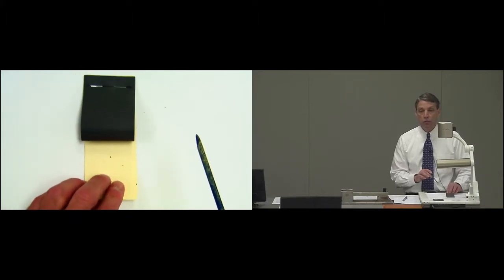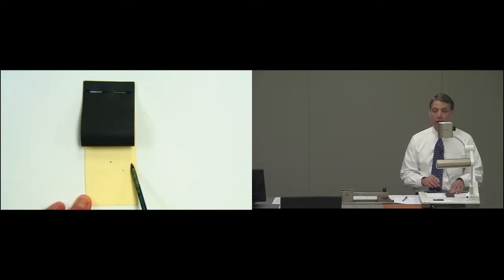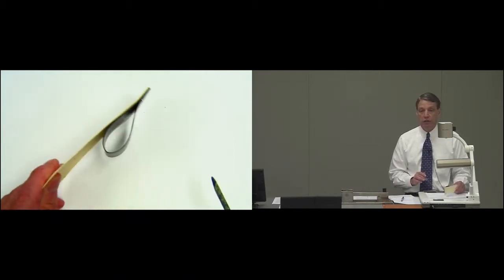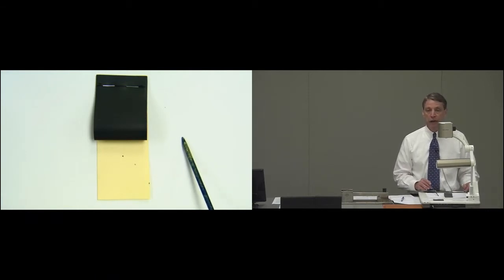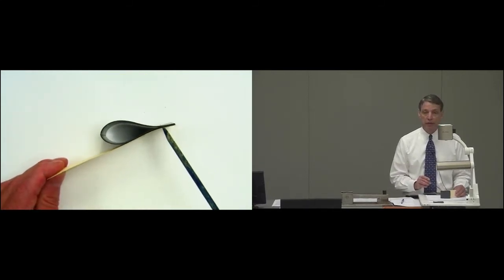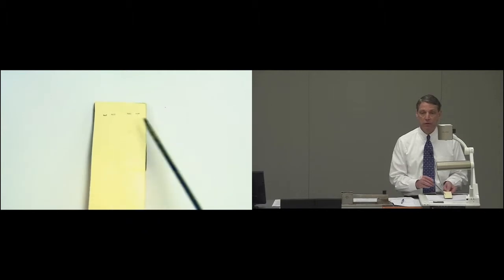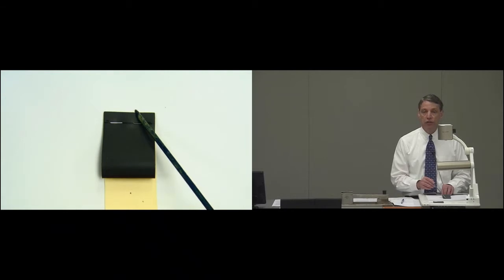The folded loop is attached to a paper card that is 2 inches by 5 inches. The paper card assists handling the specimen, placing it into the freezer and taking it out of the freezer after it is subjected to minus 29 degrees Celsius for 15 minutes. The geomembrane specimen is attached to the paper card by 2 staples. These are standard office staples. These staples are 1/2 inch from the edge of the geomembrane and the card.